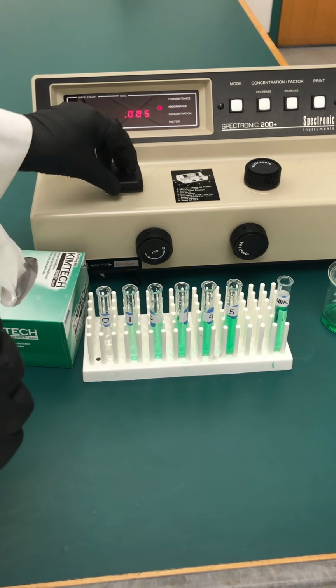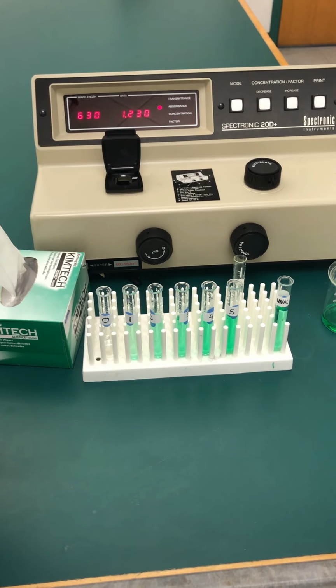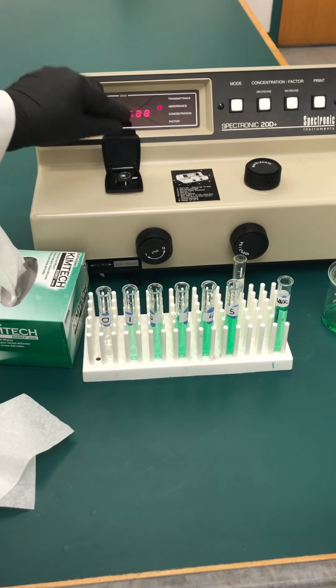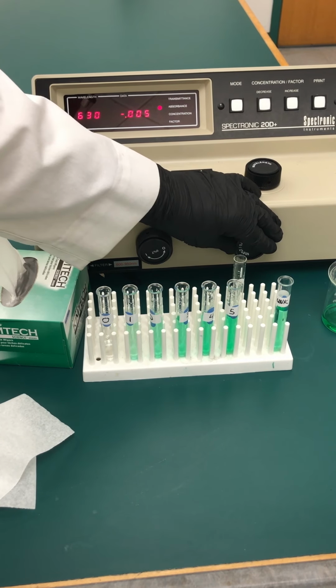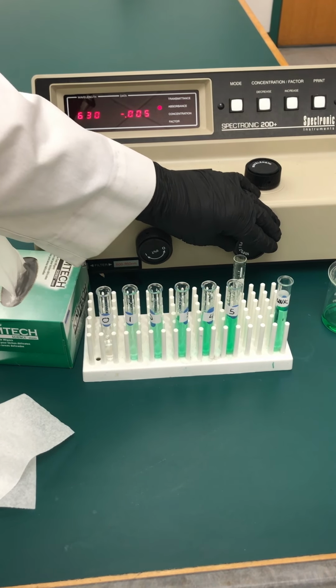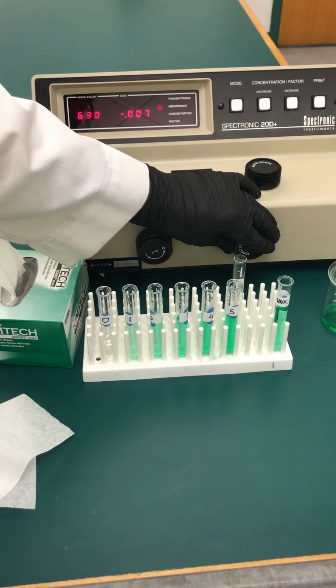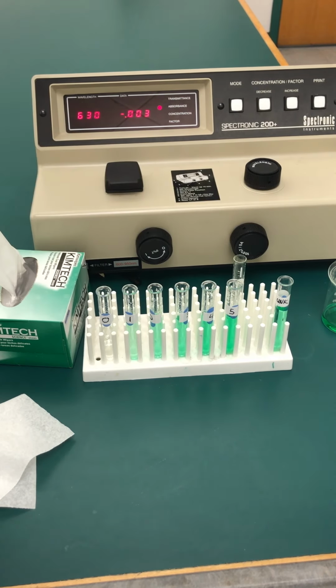blank cuvette here. Let's check it again just in case. Let's make sure that we have it at 0 still. So I'm going to put in the blank cuvette again. This is the one essentially from test tube number 0. And yes, it's okay. It's within the limits there. We can probably re-zero it a tiny bit. I'm sometimes hesitant to do this right in the middle of an experiment, but the variation is very minimal there, in the thousandths of decimals.